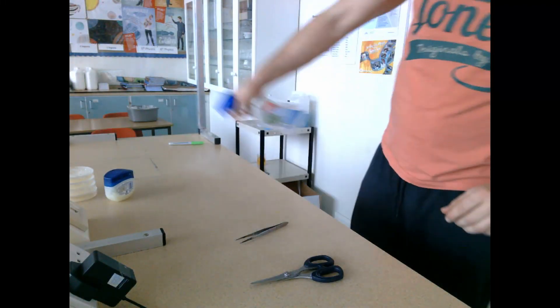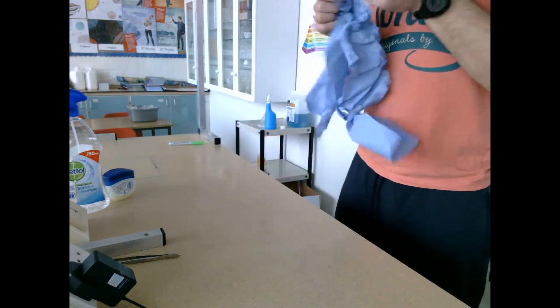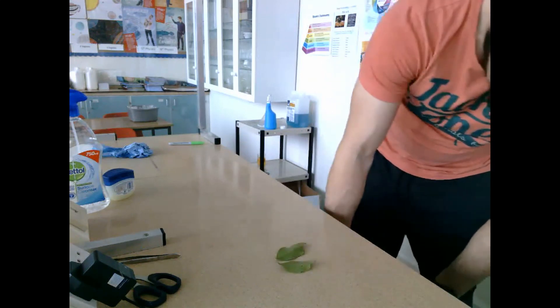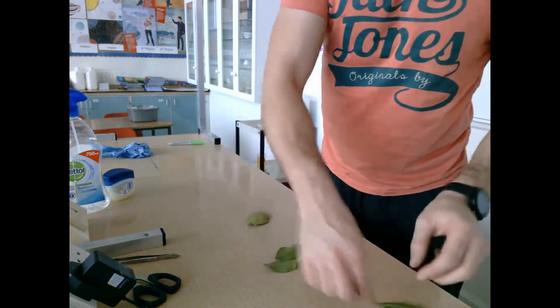In this experiment we are looking at the growth of leaf yeast on malt agar plates. The first step is to disinfect the working area and the equipment that's going to be used. This is to ensure that the area is sterile, i.e. free from microorganisms, because they could affect the experiment by getting into the agar plate and growing, which is not what we want.